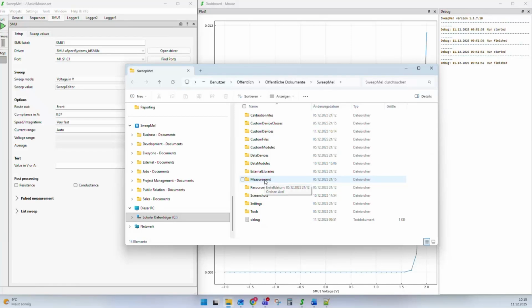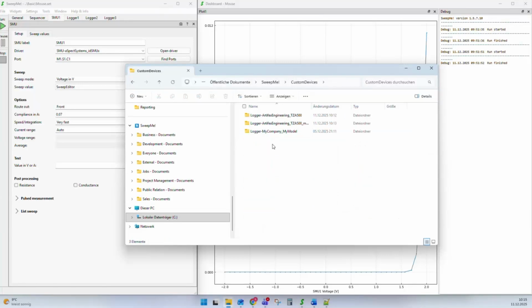Independent from which operating system account you start your Windows, all people have access to this folder and can see, for example, the measurement data and so on. One folder is called the custom devices folder. Whenever we create a custom version, you can see here this TZA500 my version. You can see this custom version that we created of the TZA500 or this completely new driver. They will all land in this custom devices folder.